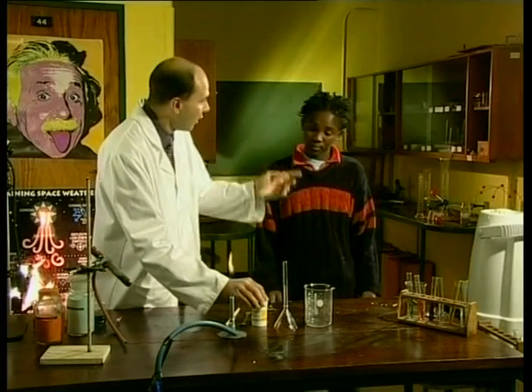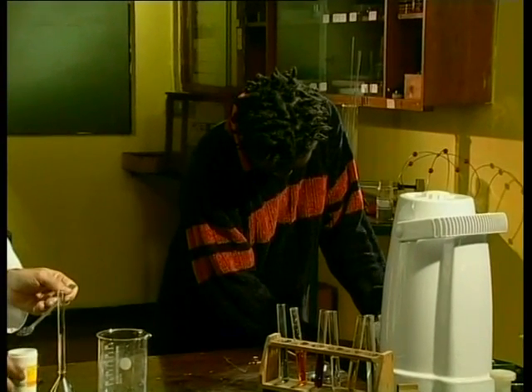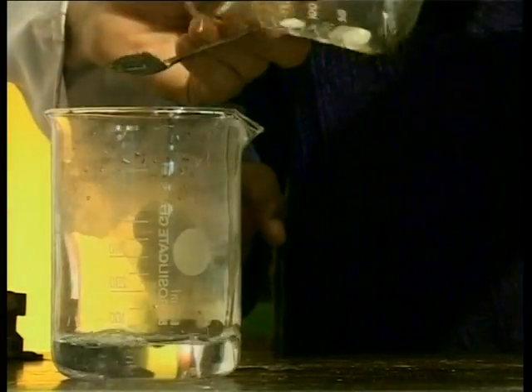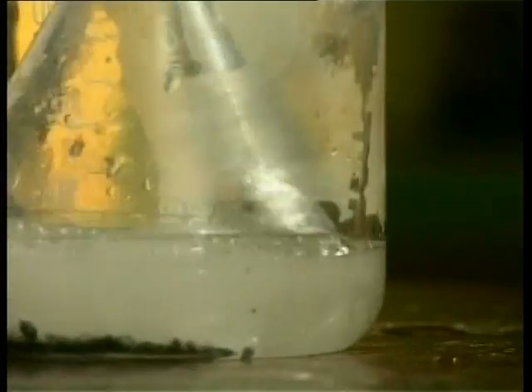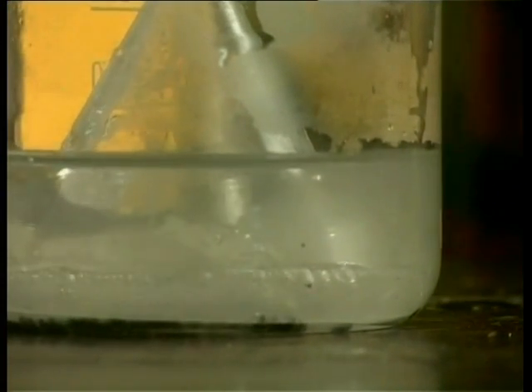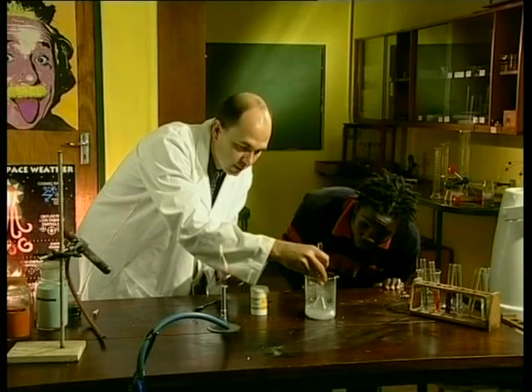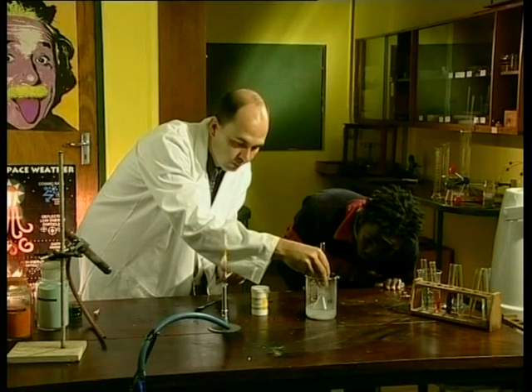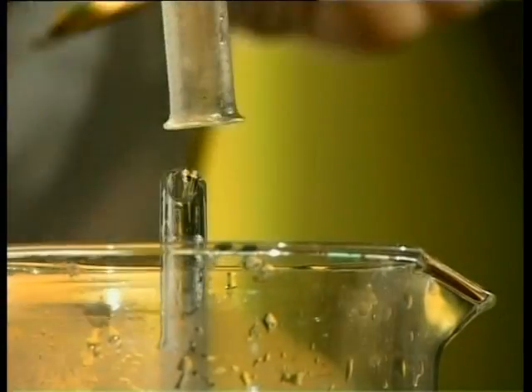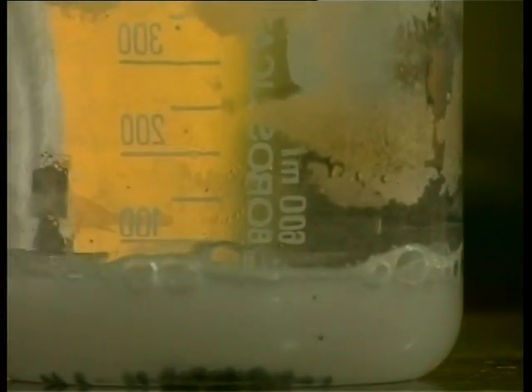We also tested with a burning splint for the presence of hydrogen gas. I'm going to repeat that experiment using hot water. Putting calcium into hot water — look and see how it goes. The reaction is far more vigorous. Gas bubbles are bubbling off and a milky white suspension is being formed. I'm going to test the gas with a burning splint to see if hydrogen was given off. Definitely hydrogen. Now test with litmus paper to see if that suspension is basic.